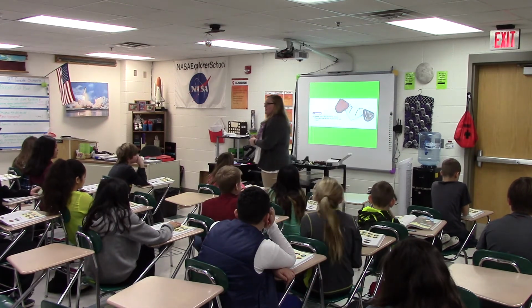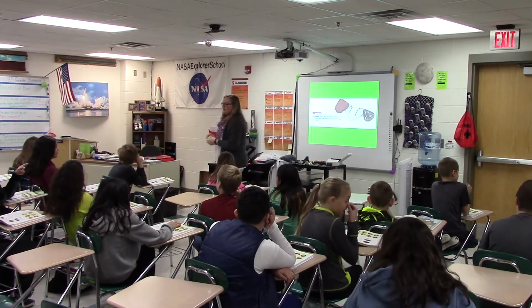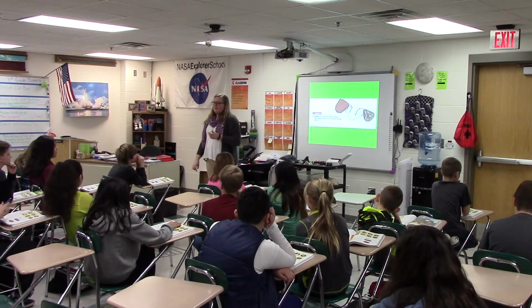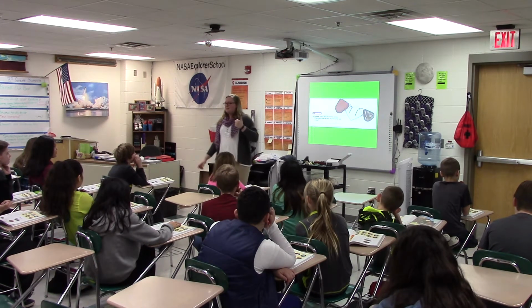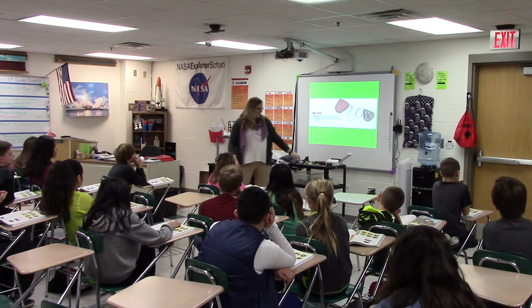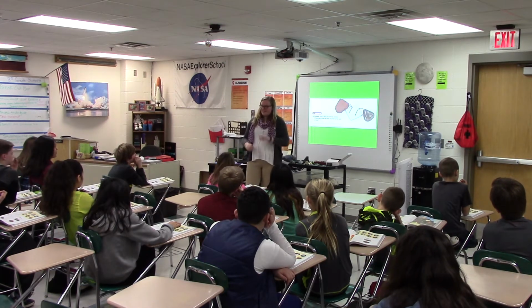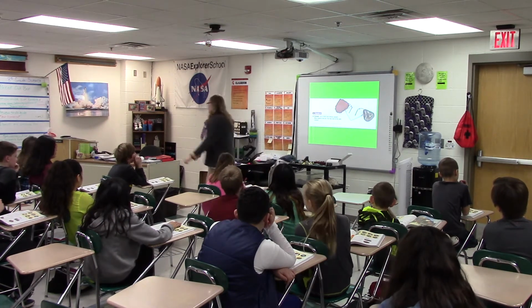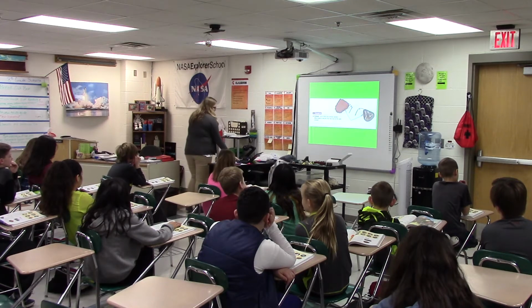porcelain plate. Luke? For the plates that you have, is there a way that you could like wash them off? Just realize too that the plates that we have in our kit are going to be a lot bigger. So you'll have a lot more room to try on. So that's our streak test.